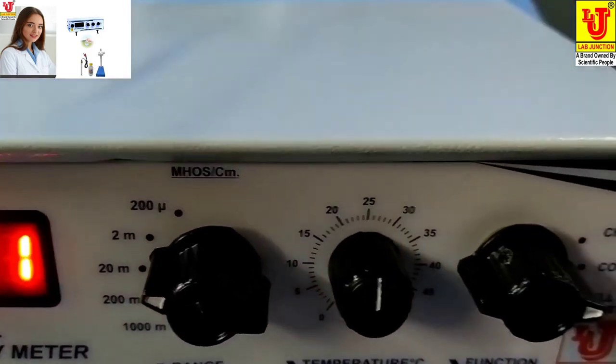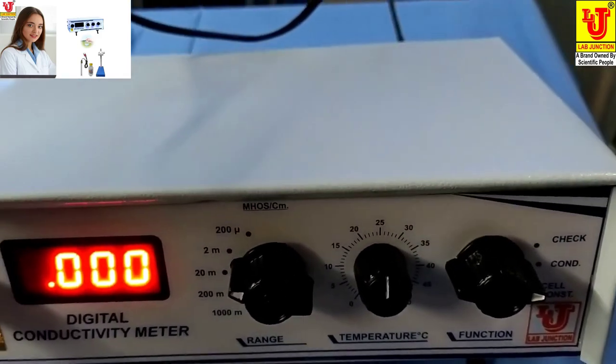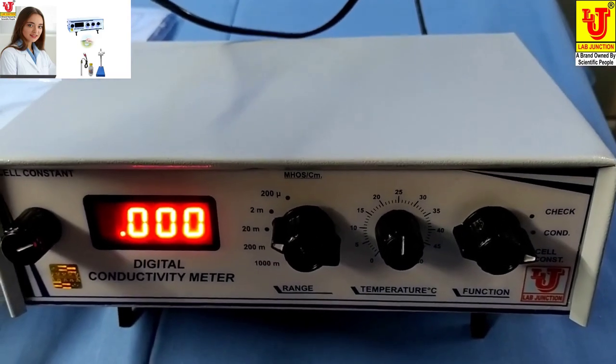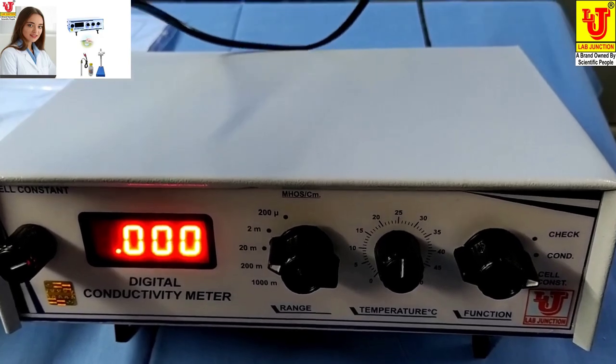And go to Conductivity. Again, your Digital Conductivity Meter is ready for use. Thanks.